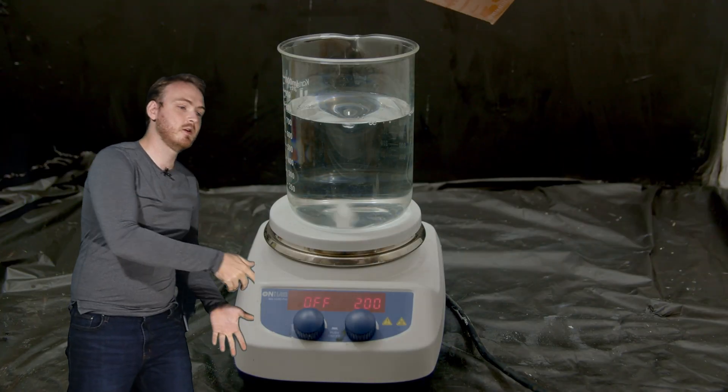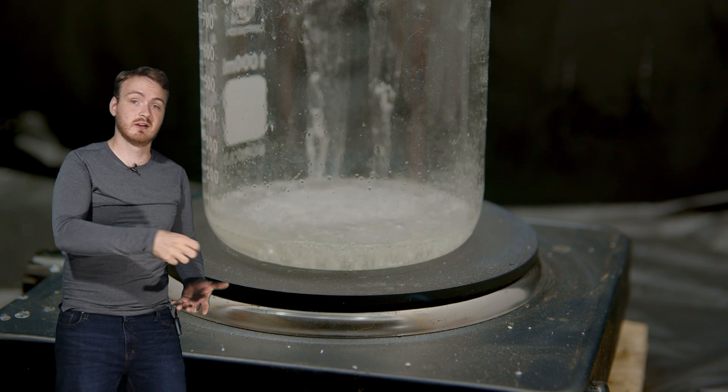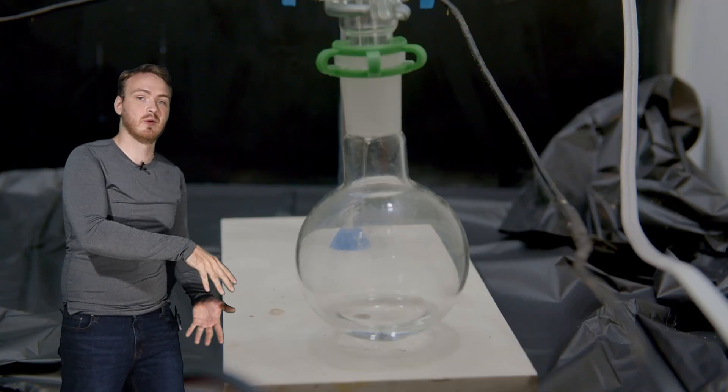Hello and welcome to Chemical Distractions. So in our last video we took all the water out of vinegar and we made it into its pure acid form.